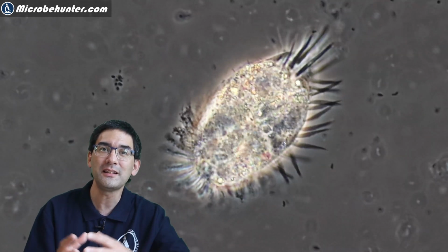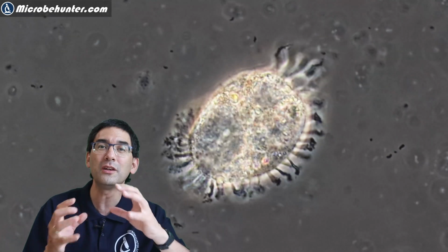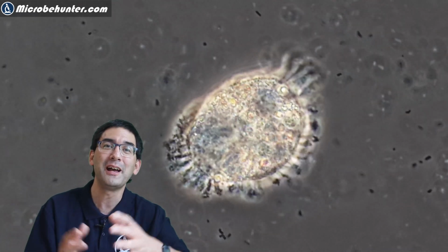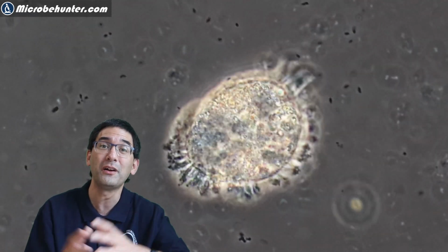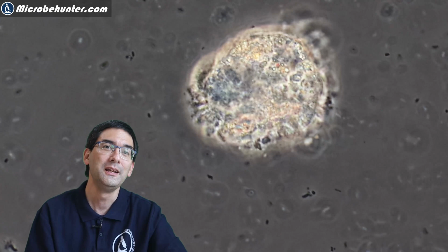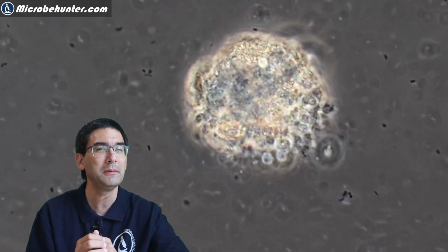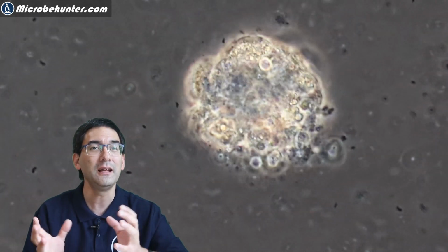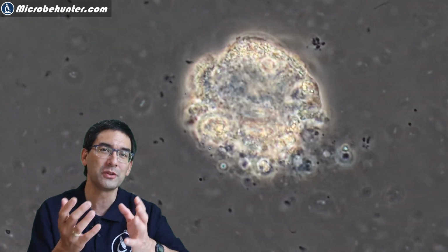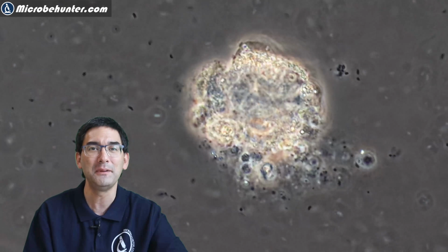Now, again, let's have a look at those bacteria in the surroundings. They are quite a bit smaller than the eukaryotic Euplotes that you see here in the center. Both bacteria and eukaryotes like Euplotes are single-celled organisms, but you can see that there is a big difference in size. If you look very carefully at the cilia, they started to curl up a little bit. It's quite interesting. Then a few minutes later, the cell started to pop open again, and the cell contents were spilled and carried away with the surrounding water stream. You see this happening right now.